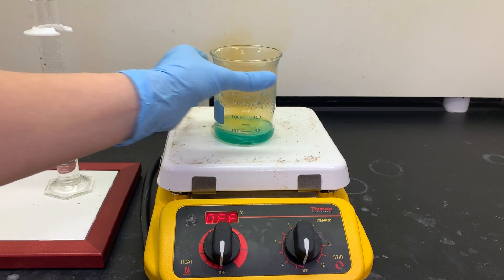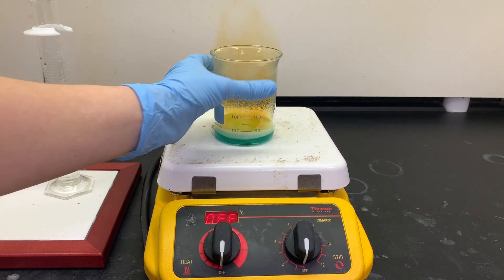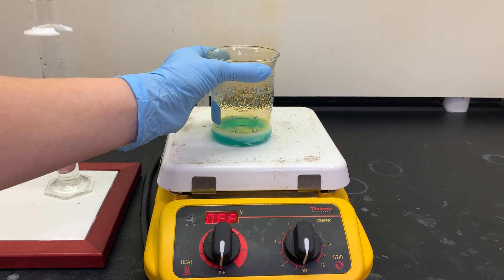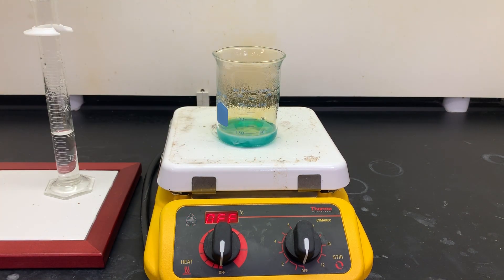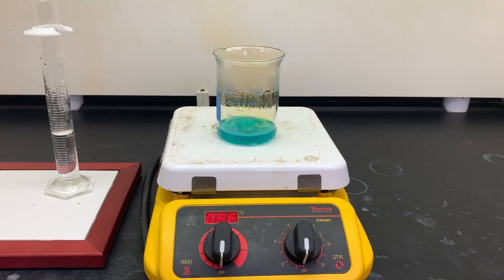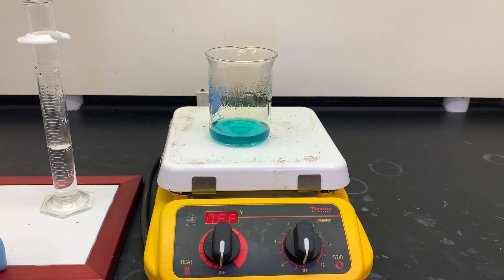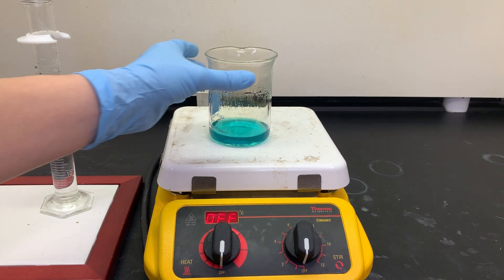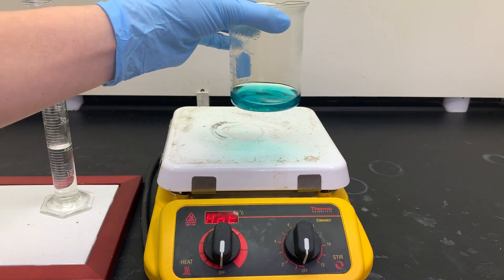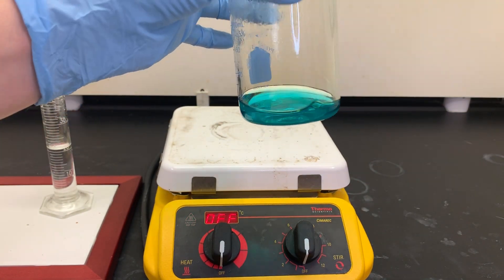Now let's speed things back up a little bit so we can get all of that copper reacted. Now I'm going to hold up the beaker so you can have a chance to record some observations of what's left. You can see that all of the copper has reacted.